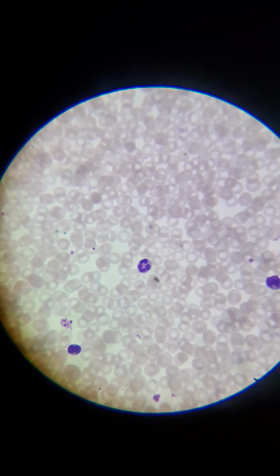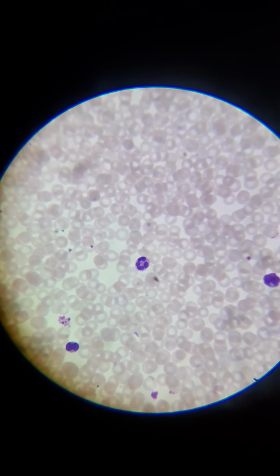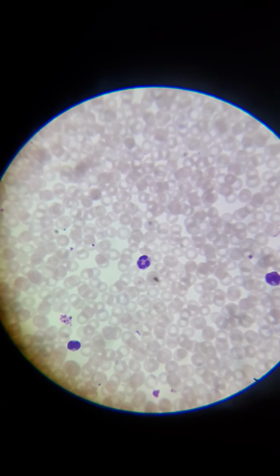There's different forms of pus, but when you get that white pus, what's called purulent exudate, that is actually mostly neutrophil debris. They've done their job and they're destroyed, and you get that massive buildup, and it blocks a lot of the process that the inflammation is trying to utilize to cure whatever is going on in the body. Okay, so that's what pus is.